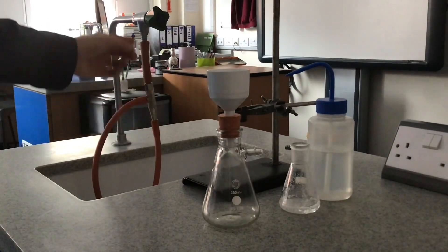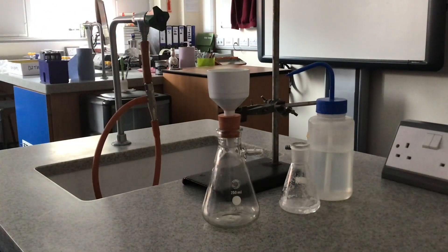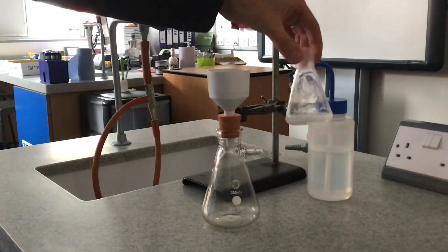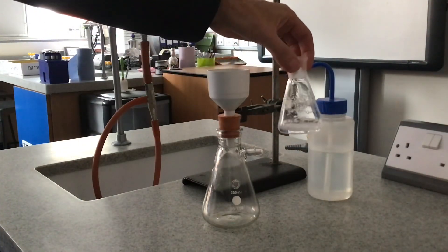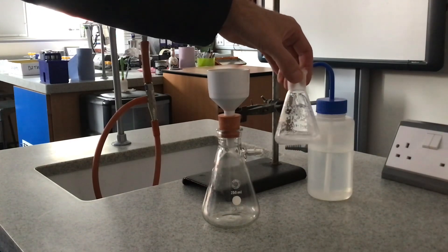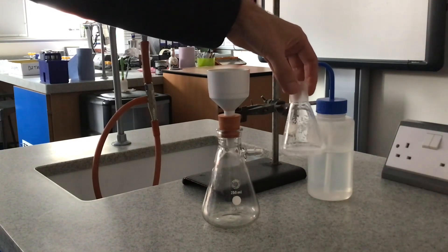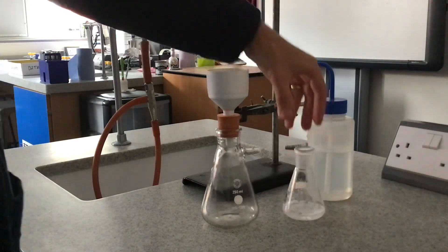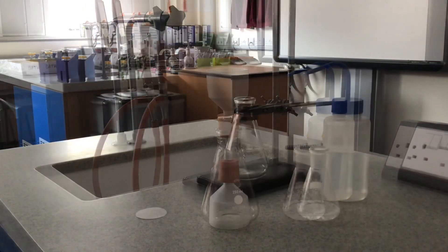This thing here connected to the tap is a water pump. Finally, inside here I've got a solid and some excess solvent. The purpose of the demonstration is to separate the solid from that excess solvent.